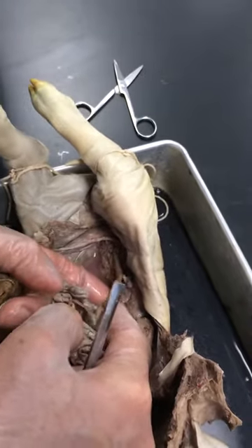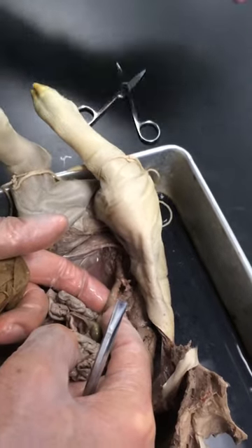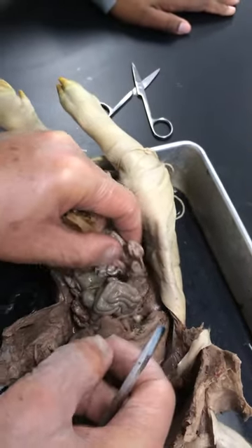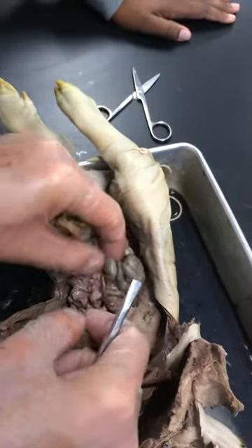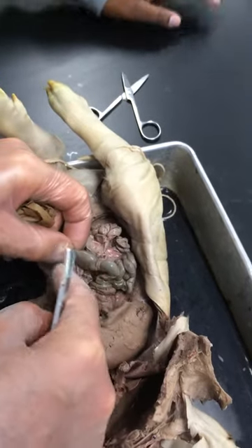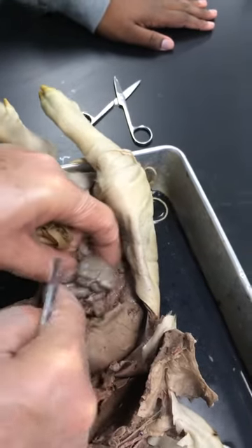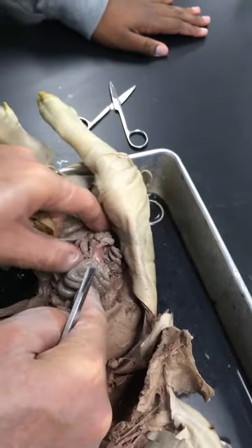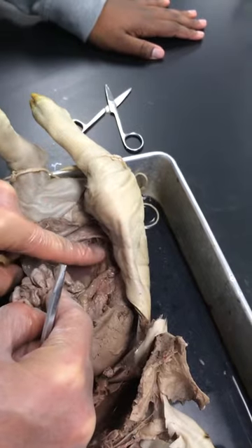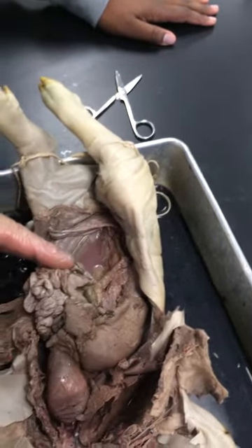That's called your descending colon. Large intestine — the three parts you need to know are: cecum, spiral colon, and descending colon.